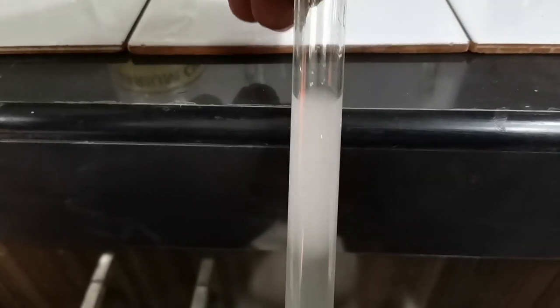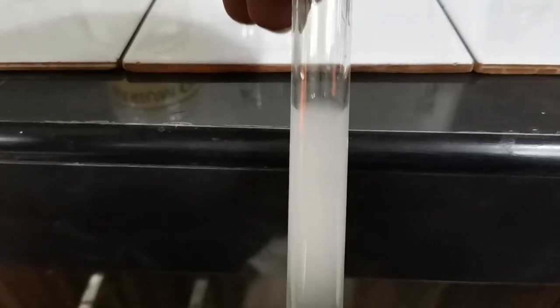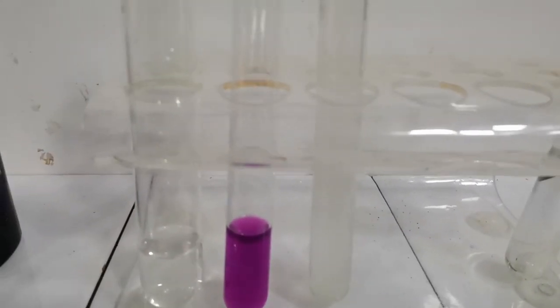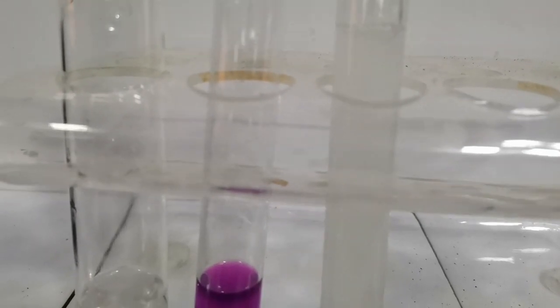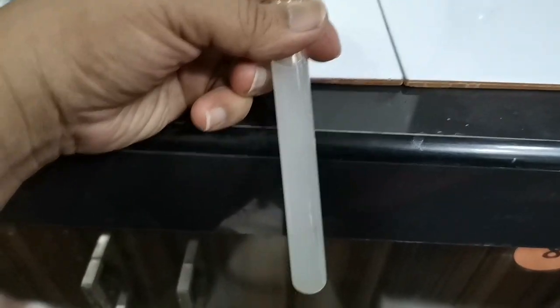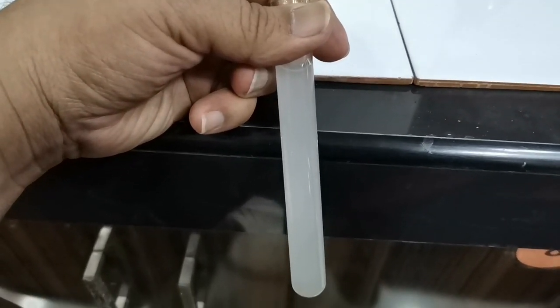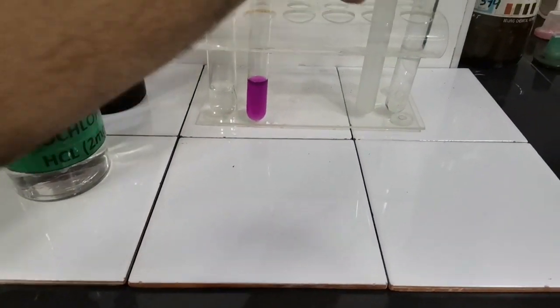On addition of barium chloride, as you can see, a white precipitate has formed in the tube that had sulfate in it, and this white precipitate now will not dissolve in HCl, unlike with sulfites where it dissolved. Now on addition of HCl, I've added lots of HCl here. As you can see, the precipitate remains, and if I shake the tube it contains a white solution, which is a solution of a sulfate, not a sulfite. So by doing these extensive tests, we have confirmed the difference between sulfates and sulfites.